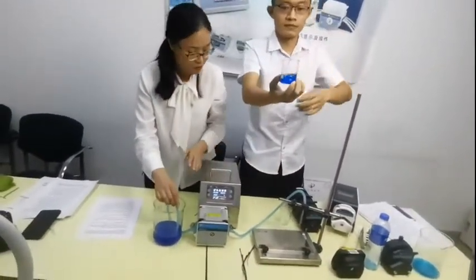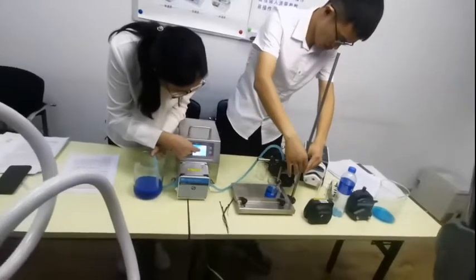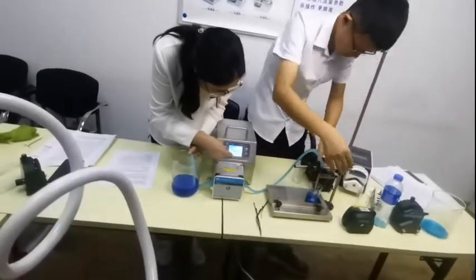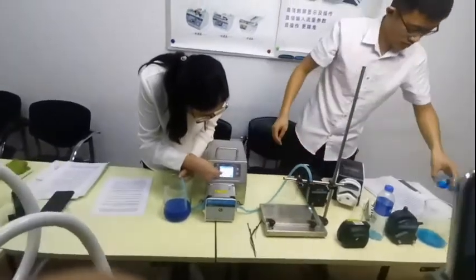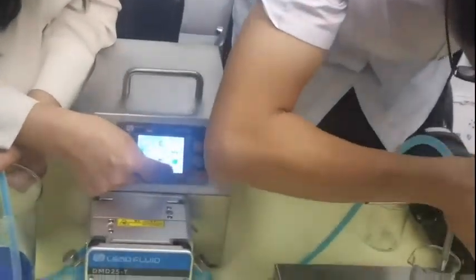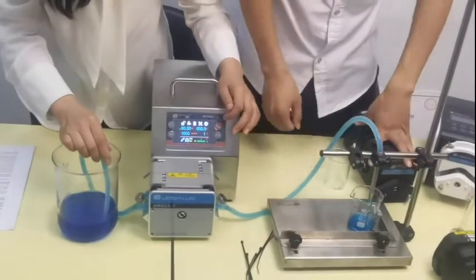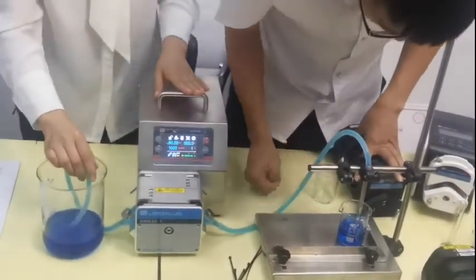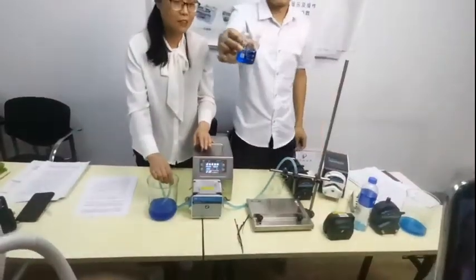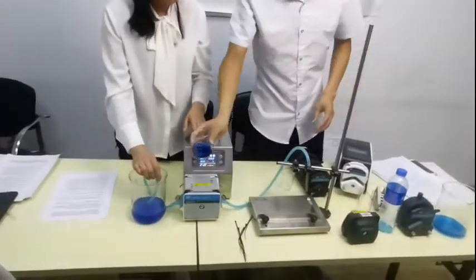Sorry, it's 40. Okay, let's go to 40. Let's press again, let's test again. Can you read it for us? 60. Really? Oh, we finished. So calibrating needs to be tested. If your calibrating is not right, maybe you cannot get the exact volume. Then you can put it in — no problem.